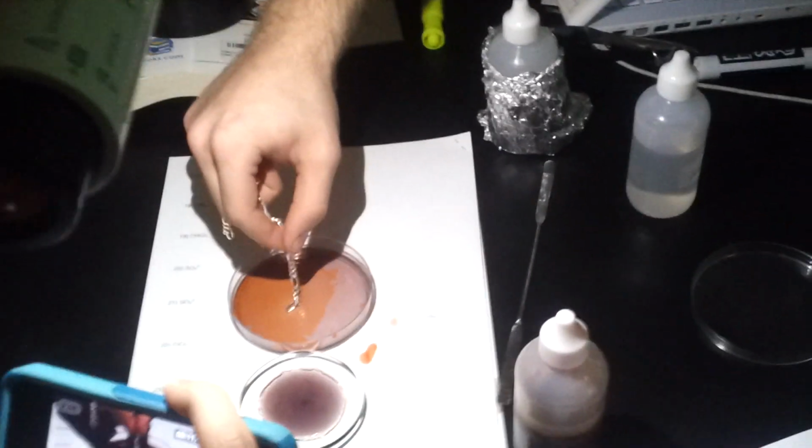What does the silver do? Well, I've never actually tried the silver before, but I have read that it works, and my idea is that you have bromide ions, and the bromide ions are involved in the activator inhibitor cycle. Looks like it worked there. Yeah. And I'm sure you guys, have you done solubility rules yet? Yeah. You know, silver bromide isn't very soluble. So I have a feeling that what it does is it just drops the bromide concentration locally wherever you touch the silver to it, and that should get it going. But I'm not 100% sure if that's the reason.